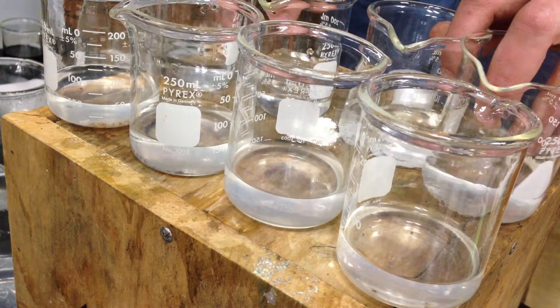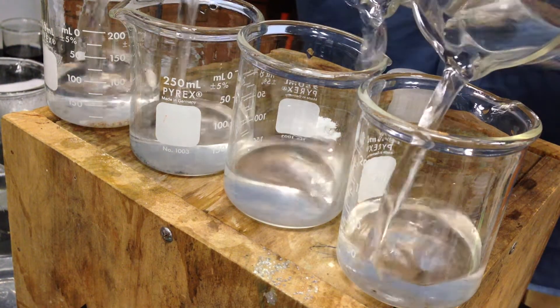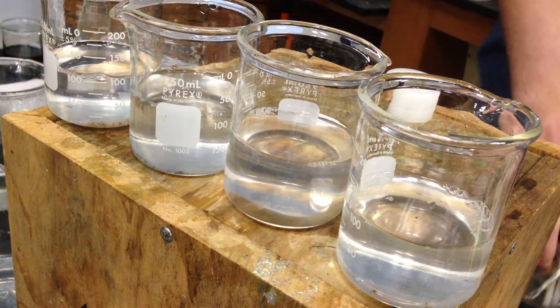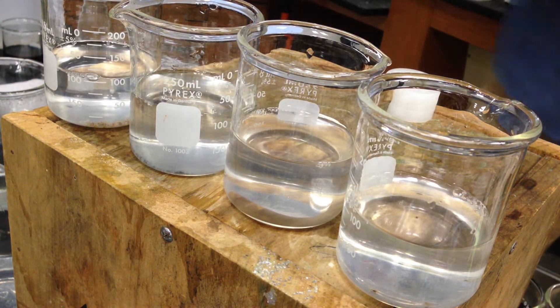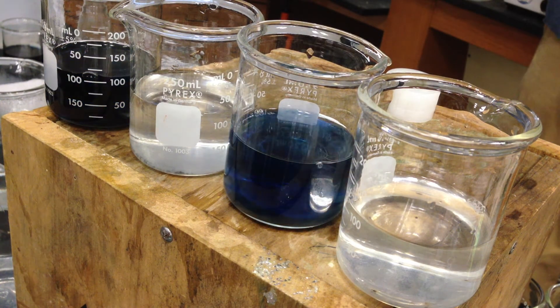Yeah, okay, so ready? One, two, three. So once I hit that ten-second mark, we should see one of them go. You get that nice clock effect. One. Here we go. Ah!